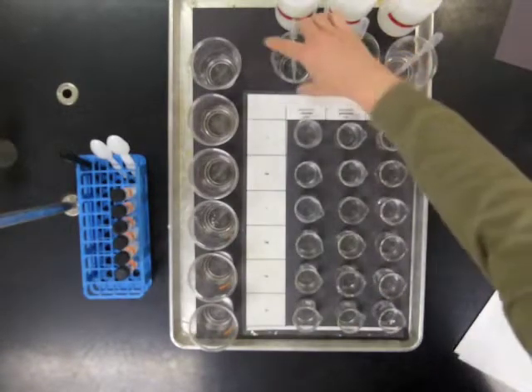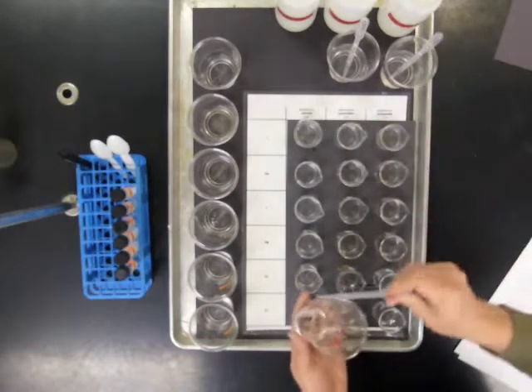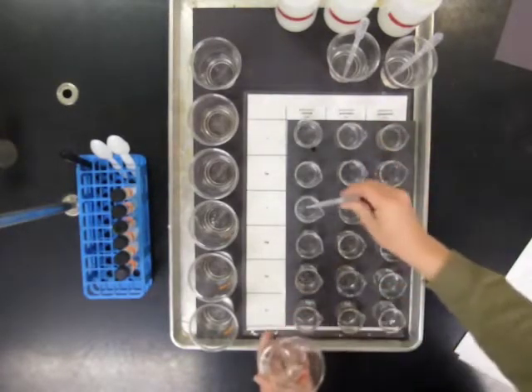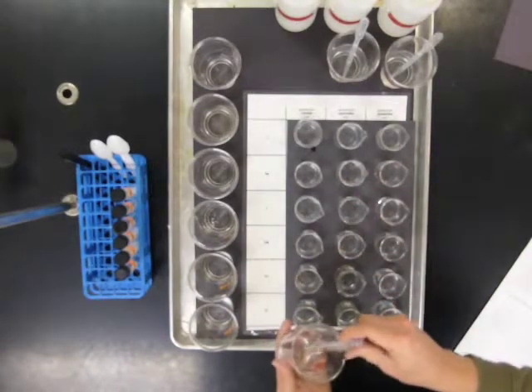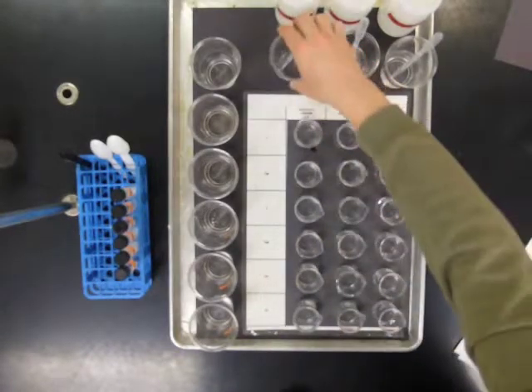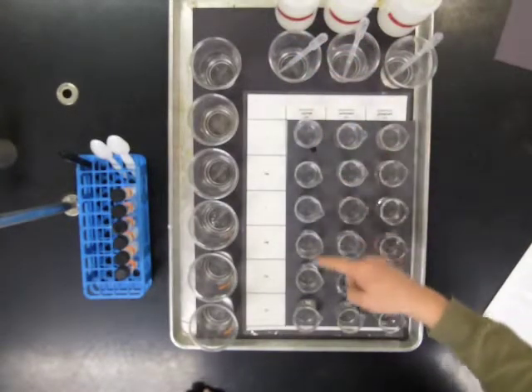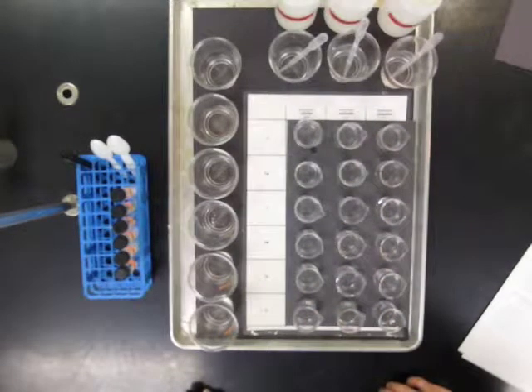And now I'll put in the chloride negative ion to see if it reacts or not with any of the substances that we're testing. What we're looking for is a chemical reaction that forms an insoluble material. When you look at the substances that we're starting with, you see that they're all clear, colorless solutions, which means that the materials that are in there are completely soluble in water. Chloride doesn't make any insoluble compounds with the substances that are being tested.